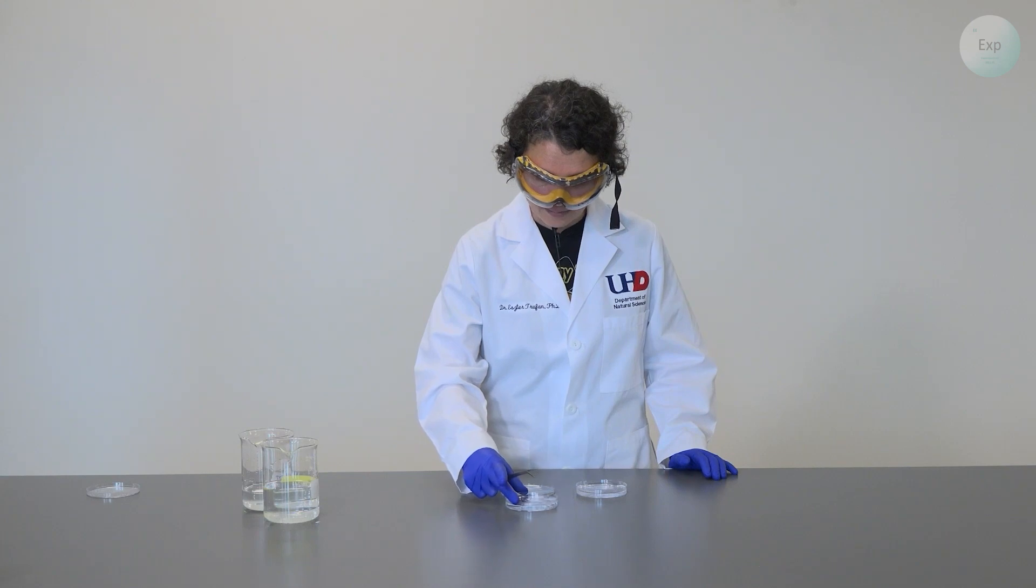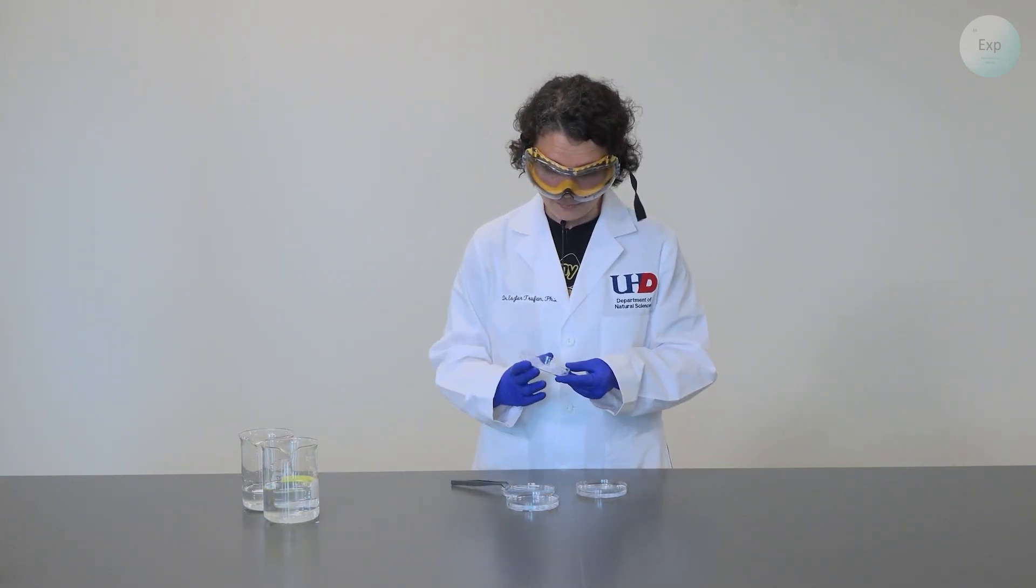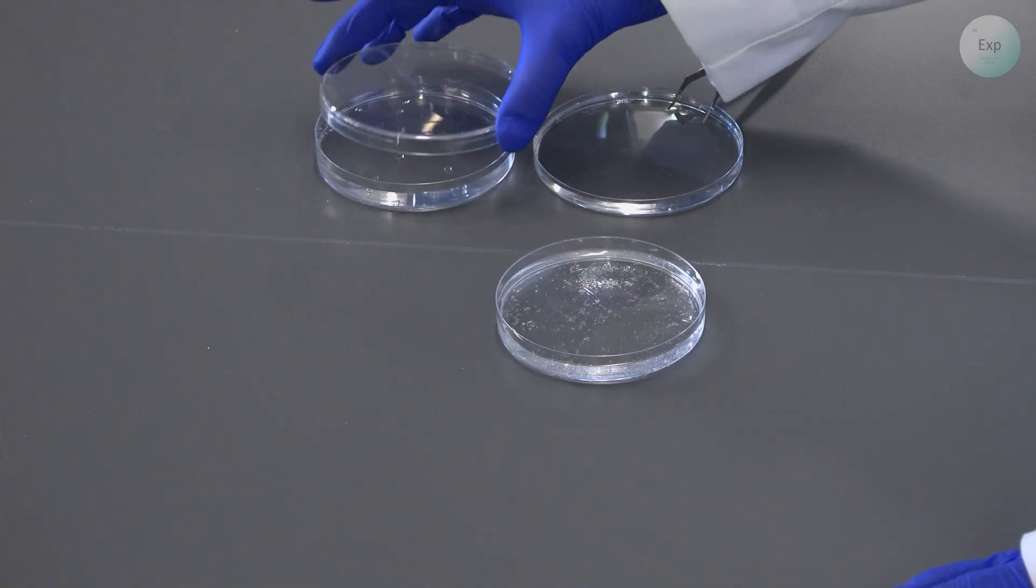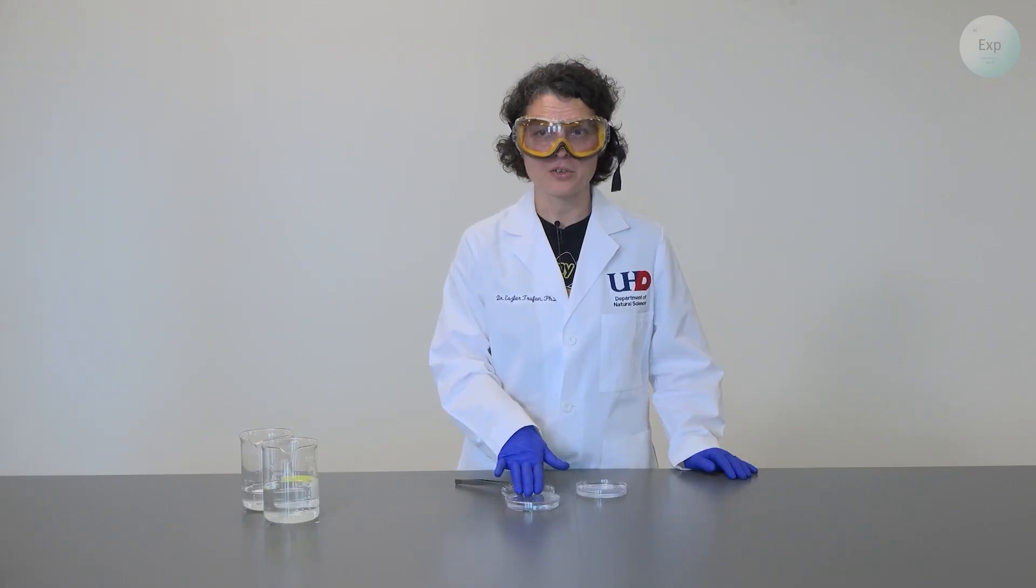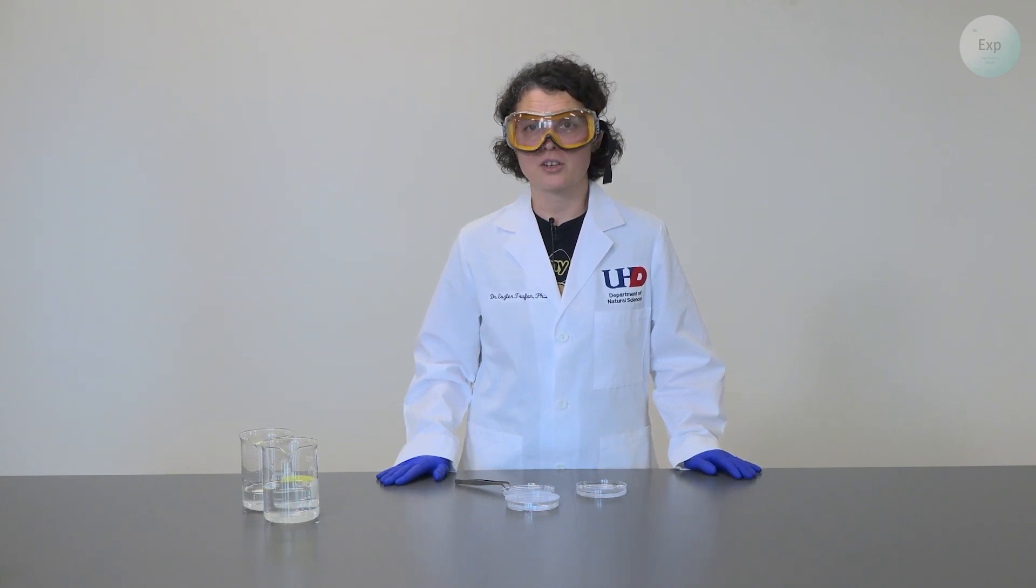I have selected five crystals in my grow solution and at this point I can take the lid of my original crystal growth mixture, place it on top, and then set my newly separated crystals apart so that they can grow undisturbed for another couple of days.